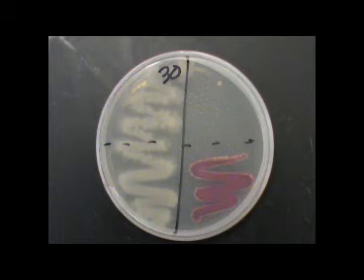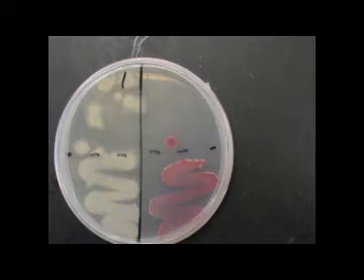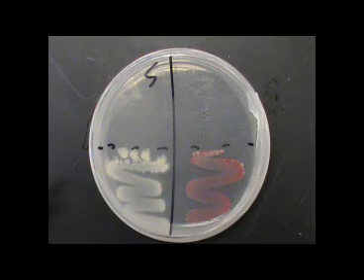Serratia, on the other hand, is a non-endospore-forming gram-negative rod. This organism had no protection from the UV light and was incapable of growth after 30 seconds of exposure. After 1 minute of exposure, Serratia is still not growing, and Bacillus is beginning to show less growth. After 5 minutes of UV light exposure at a germicidal wavelength, neither Bacillus nor Serratia is capable of growth.